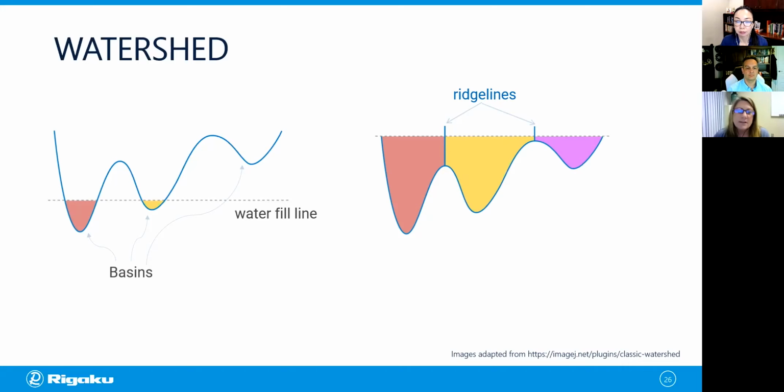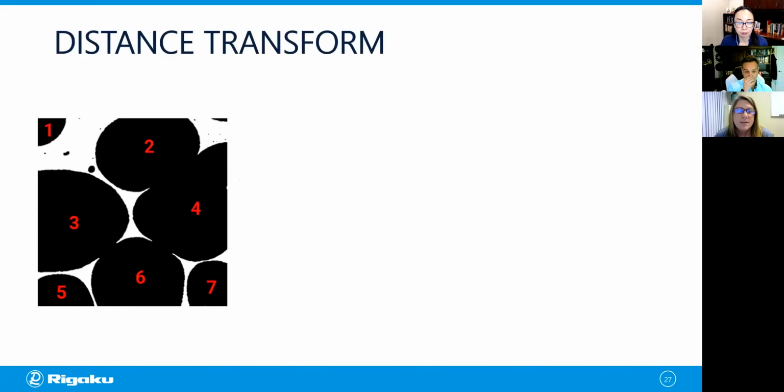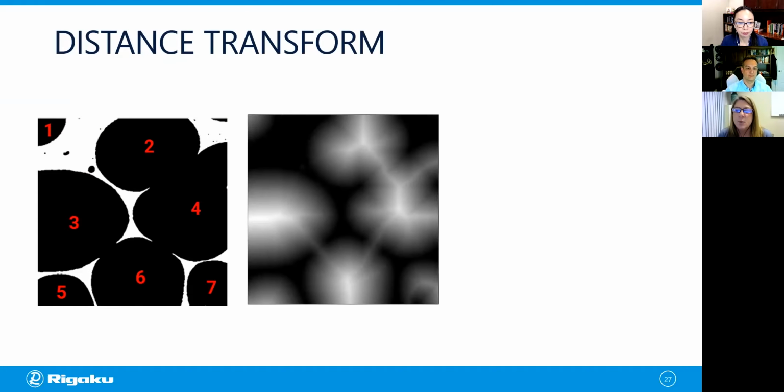So how do we transform our ROI into a set of these actual basins? Well, we're going to use a tool called a distance transform. Here we see our original foam image. If we picked our objects by eye, we'd say, okay, we have 1, 2, 3, 4, 5, 6, 7, and maybe a couple of other small ones. We want to separate those into the individual objects. So we're going to use the distance transform, which computes the distance between each labeled void pixel and the nearest foam pixel. So we have the result of the calculation here. In the middle of the void, the value is high, so a lighter color in the grayscale. When you get closer to the polymer, it becomes darker and darker gray, and within the polymer, it's black.